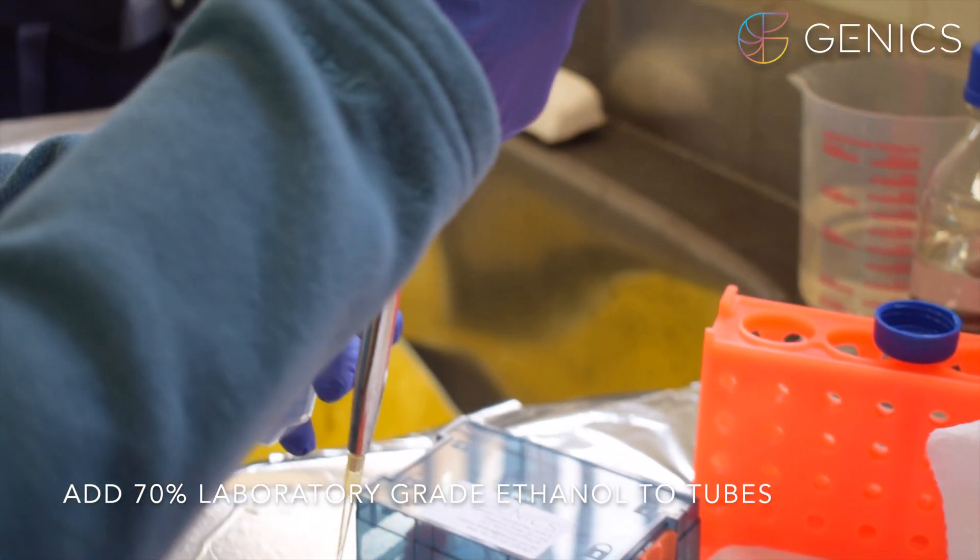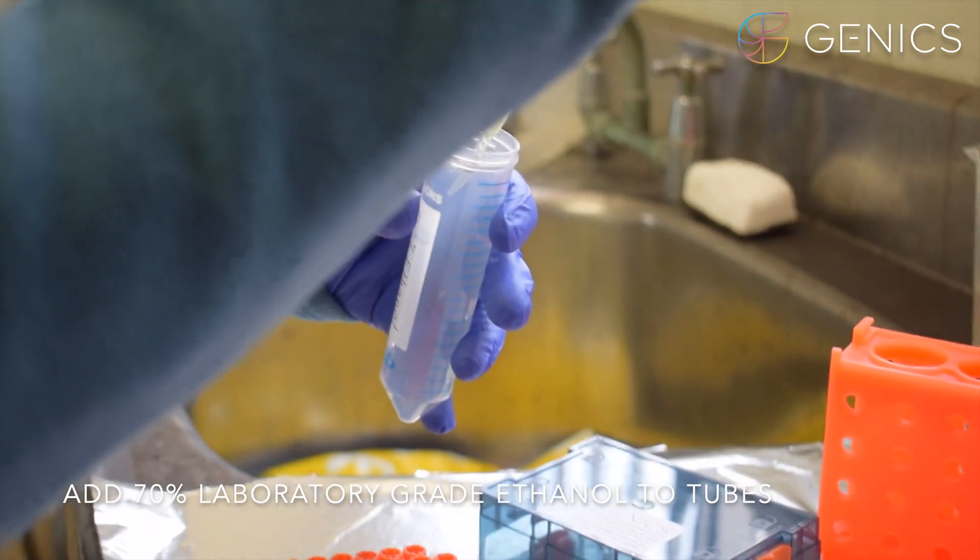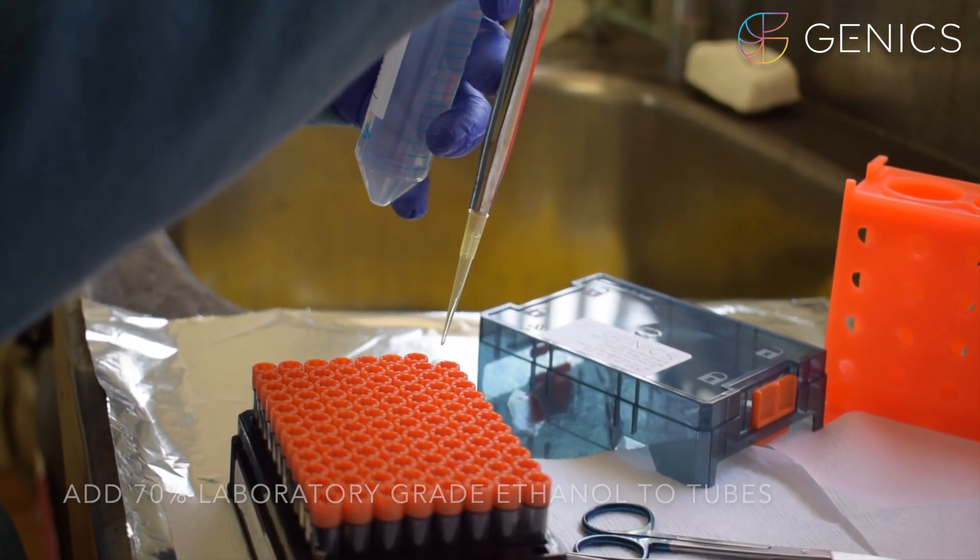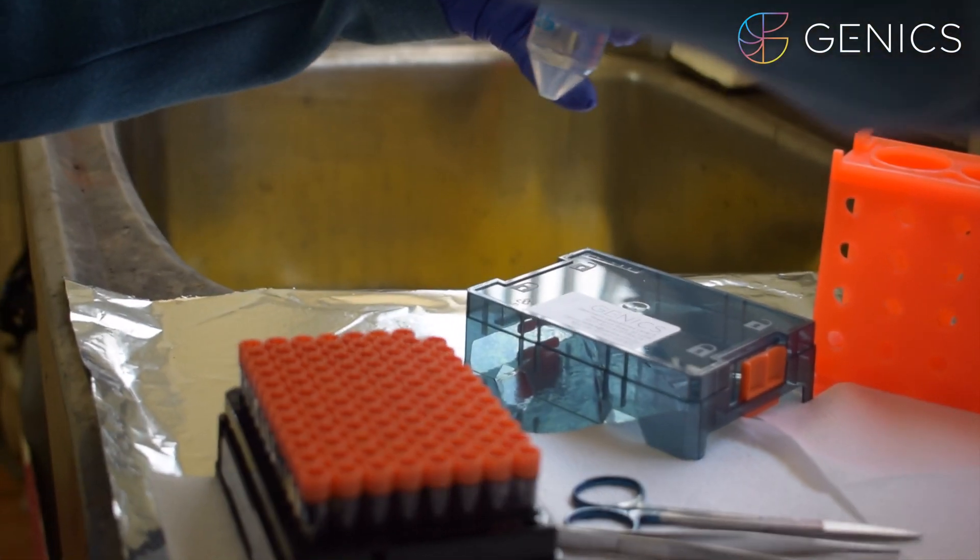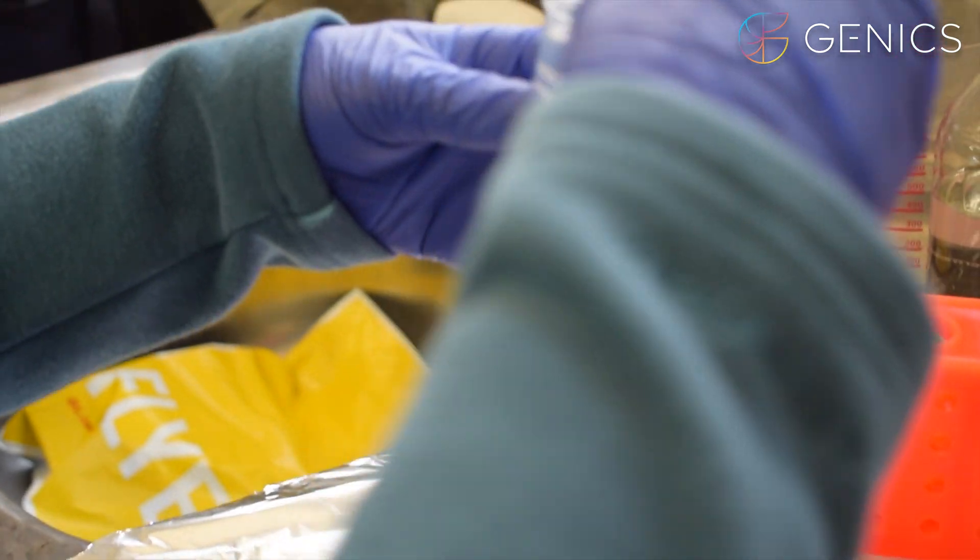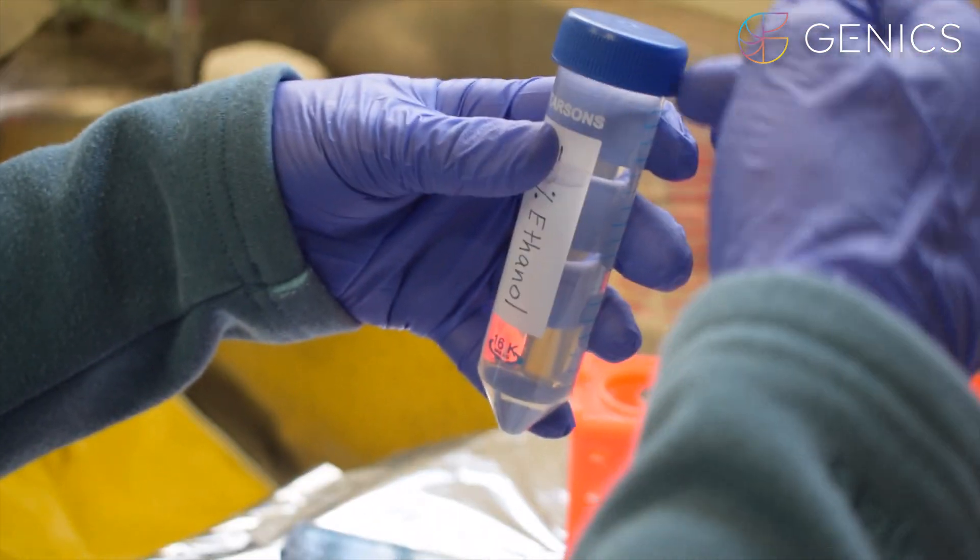Here I am using a sterile pipette to transfer the ethanol into the tube. Once this is complete put your lid back on your ethanol stock so that it stays clean and does not get contaminated.